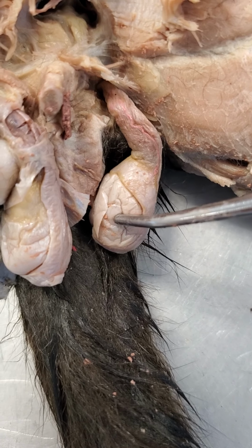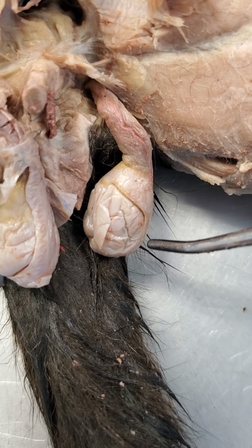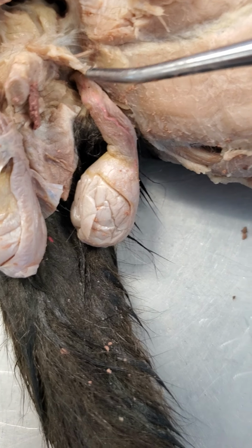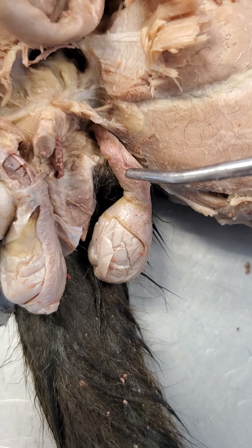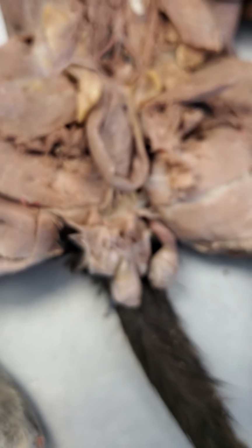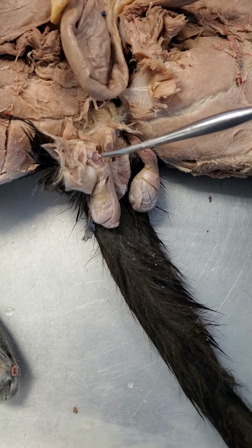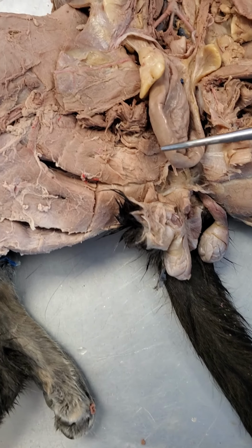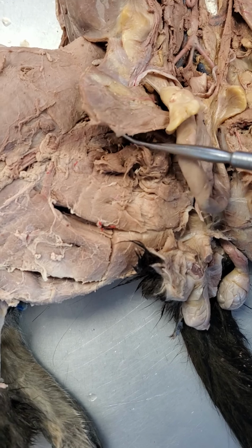Now if we look over here, we can also see the testis, and we can see the epididymis that's kind of wrapping around this other side. And so the epididymis is just back here. Another thing that we notice, of course, again, is the spermatic cord that's leaving, again, carrying the vas deferens, the spermatic vein, the spermatic artery, and the nerves to go along with it. All right, so another thing that we'll notice is the spermatic cord going in towards the abdominal cavity. And if we look up here, again, this is the abdominal wall that we folded down.